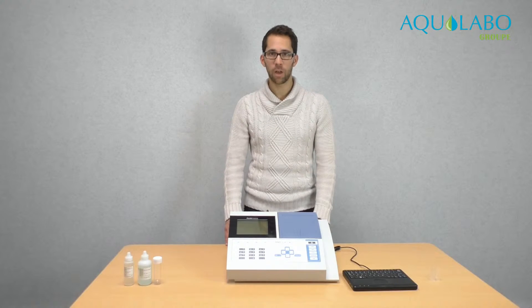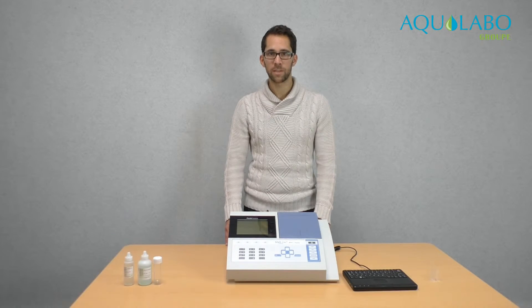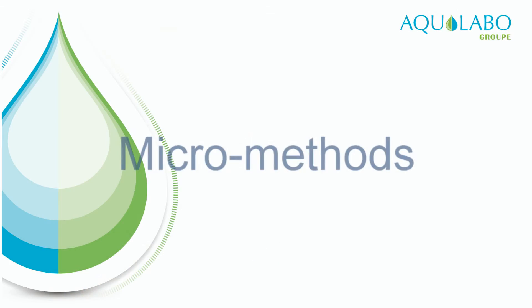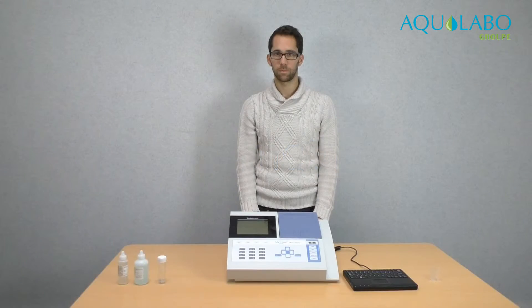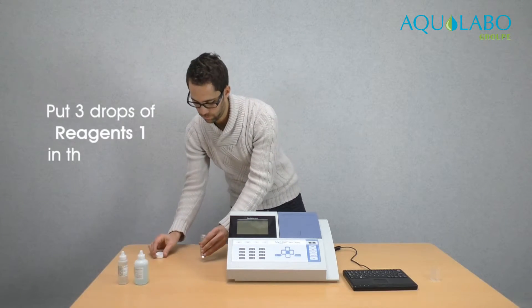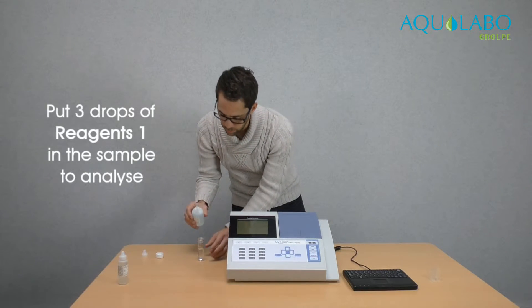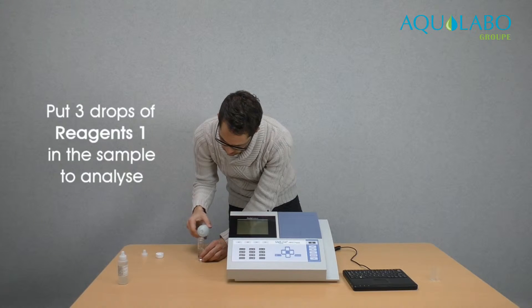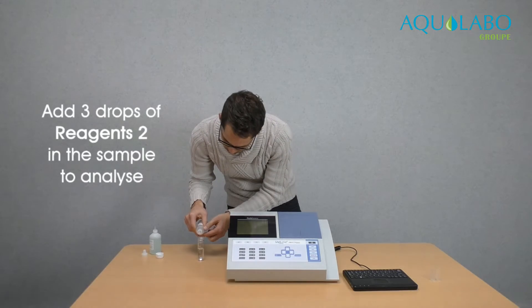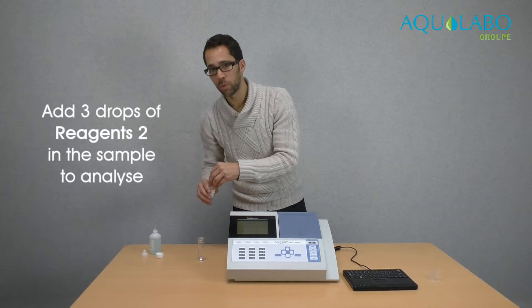To see the functioning of the device, we will conduct an analysis of nitrates. First we will make the analysis with reagents, then we will see the analysis without reagents. Here is a sample of water containing nitrates, and here is a kit of reagents for nitrates. I put 3 drops of the first reagent and 3 drops of the second reagent. And then we wait 3 minutes for the reaction.